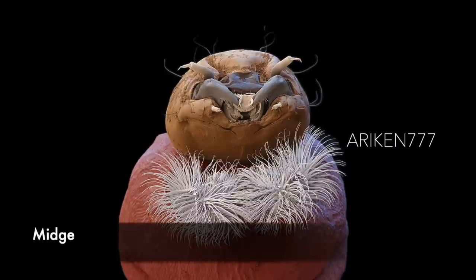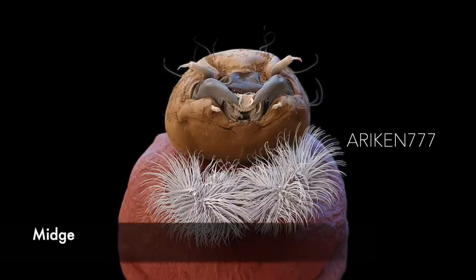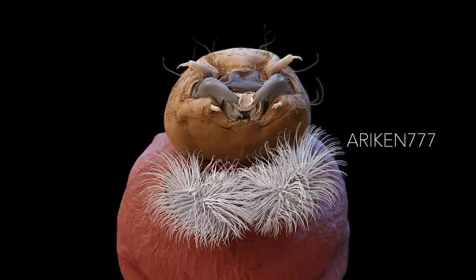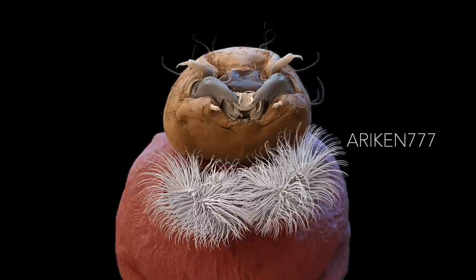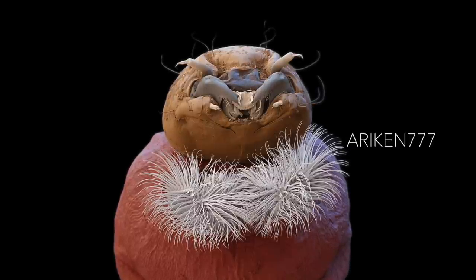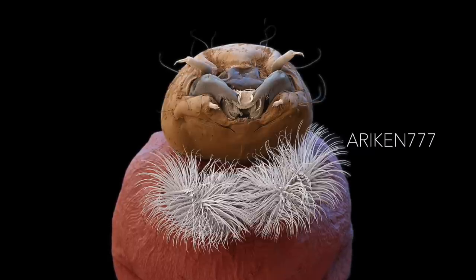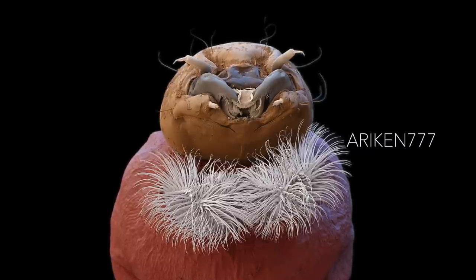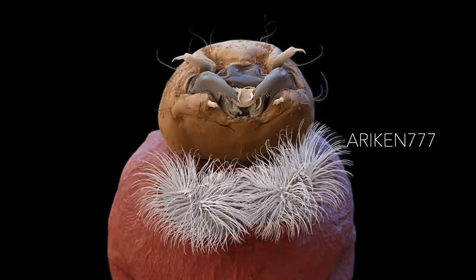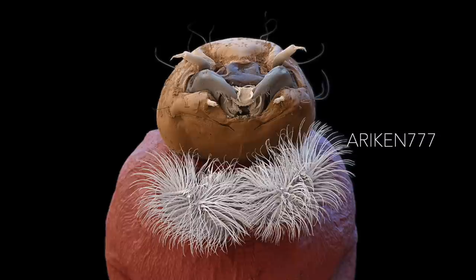This is a non-biting midge, which is just a few millimeters long. One of their common names, dancing flies, is illuminating since the males gather into great swarms and perform an undulating mating dance. While walking or biking, one can easily run into one of these clouds, and although the flies do not bite, people with allergies can get a sneezing attack or rash on their skin.